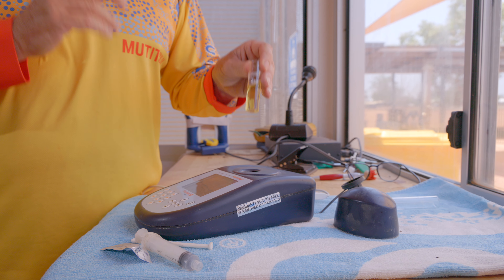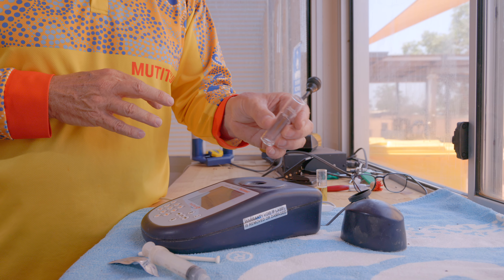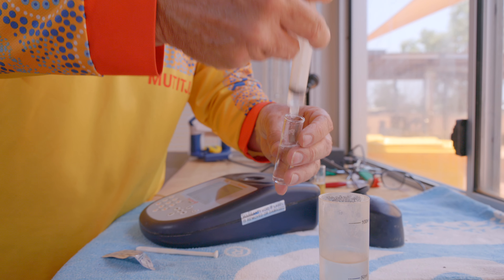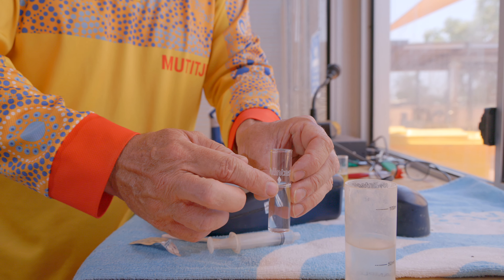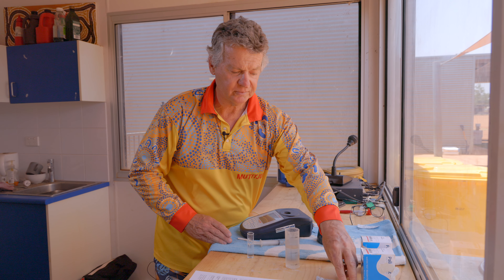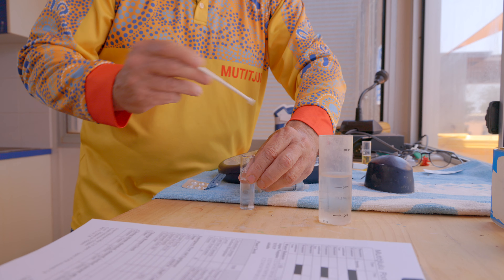The next test we're going to do is cyanuric acid. Simply remove the alkalinity test and we start the procedure again by getting a clean test tube and getting our sample water. As with before, we fill it up to the diamond. As we've already blanked the unit, we don't need to do that again. So next we get our cyanuric acid tablet, break it from the blister pack, and crush it up.